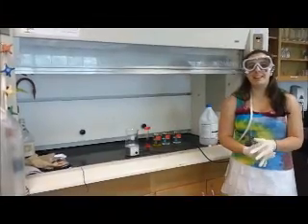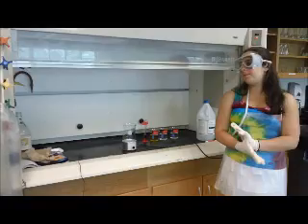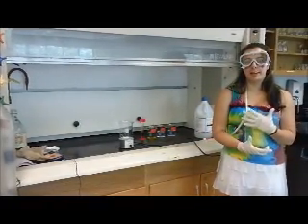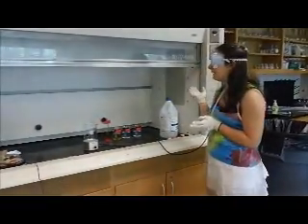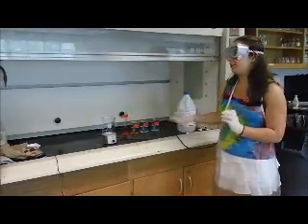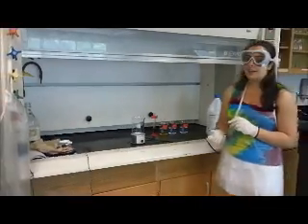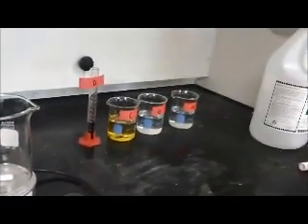Alright, so before we begin the reaction, there's a couple things I want to cover. So one, because some of the chemicals will react to produce bromine gas, which is toxic to inhale, you should be doing this experiment in a fume hood, and it'll suck all the toxic fumes up and out of the building. And also you need a magnetic stirrer and a large beaker that you can mix everything in. There are the solutions.